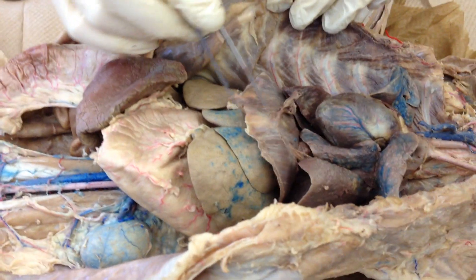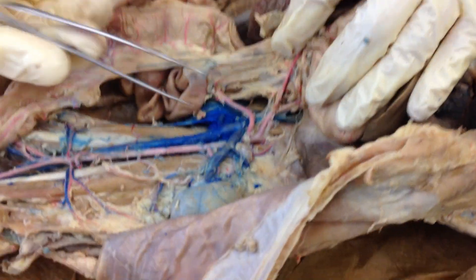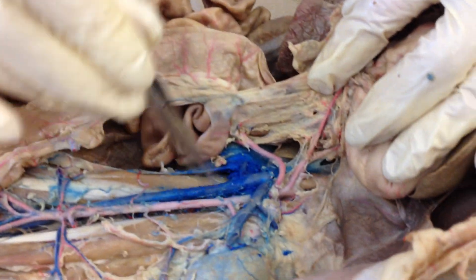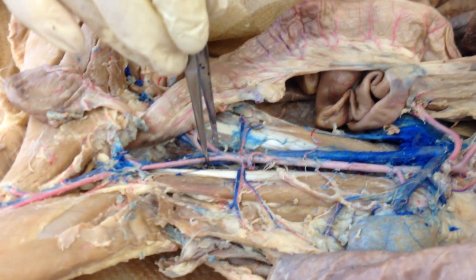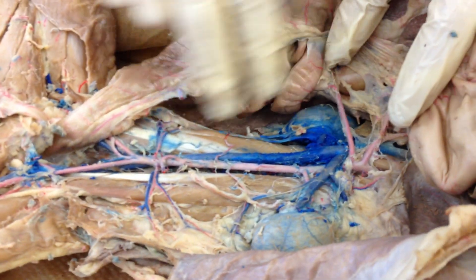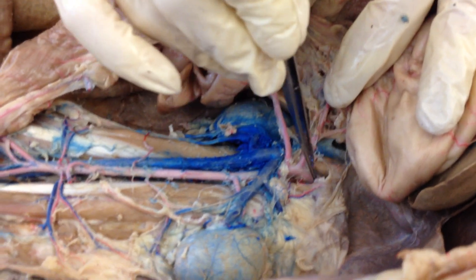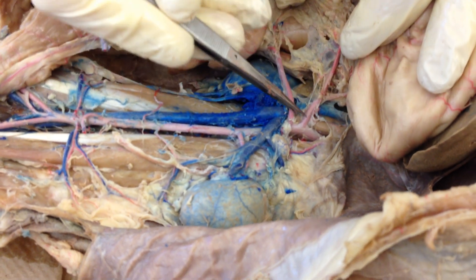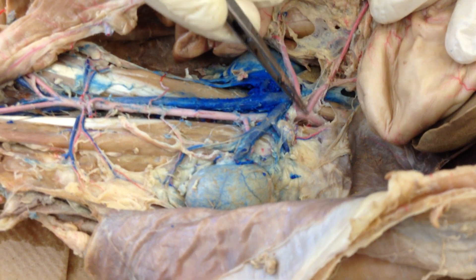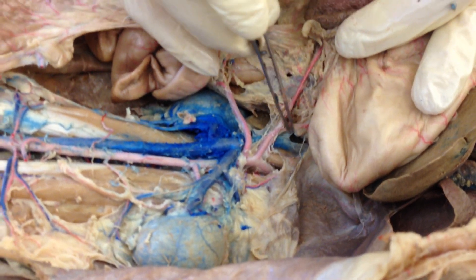Let's move down into the thoracic cavity. Once you hit the diaphragm, the aorta becomes the descending abdominal aorta. It starts right up here and goes all the way down until it splits at the iliacs. When it comes through the opening in the diaphragm, here's the aorta. The very first branch that comes off the aorta is the celiac artery. The celiac branches into a number of different arteries feeding the liver, the pancreas, and the stomach.